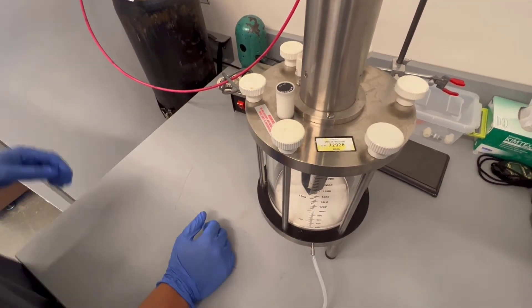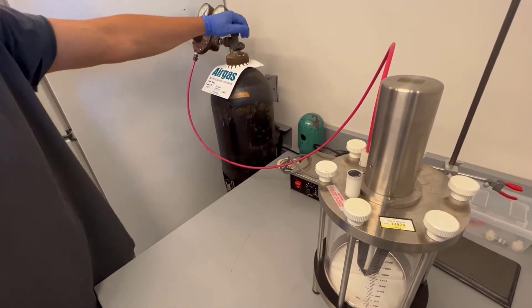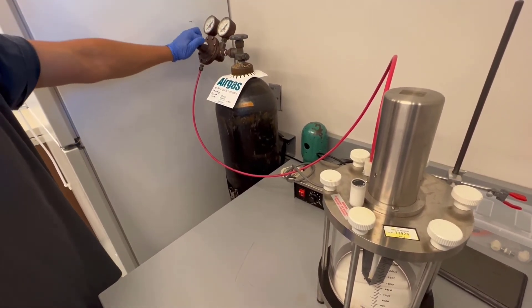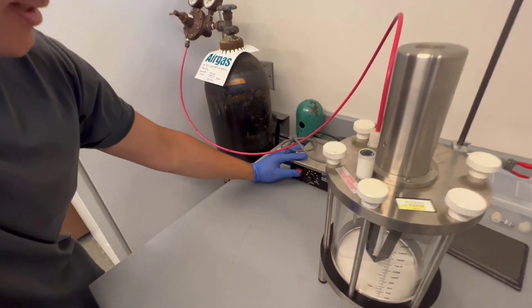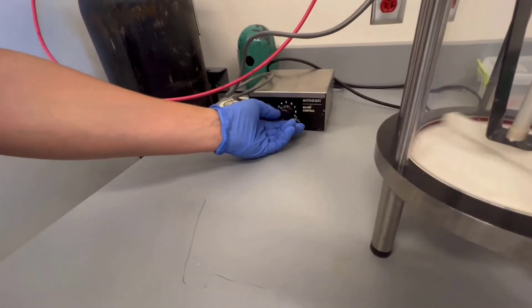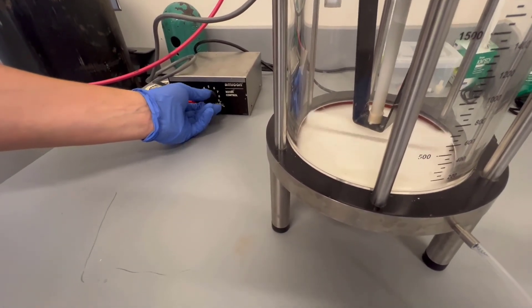And once you get that in, you can start supplying your gas. This is going to loosen the gas tank for you, and this is going to be able to control how much you supply at a certain pressure. And lastly, this stirring mechanism here is where you're going to have it either stirring or not stirring, and as you can see, it's going in the cell right now.